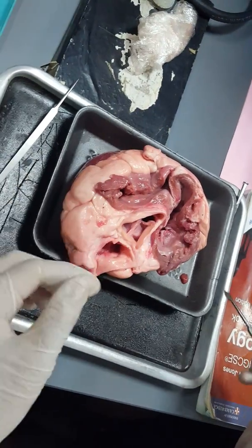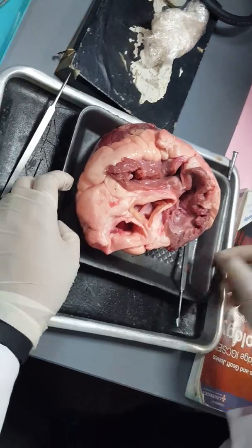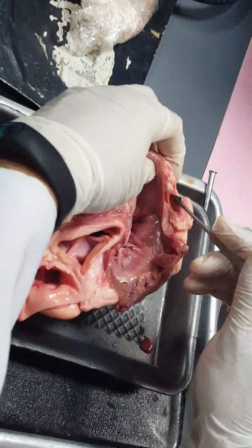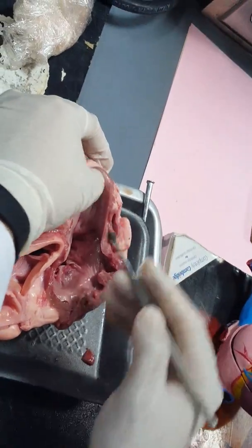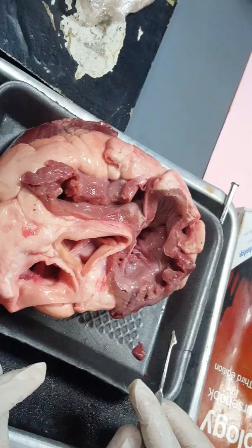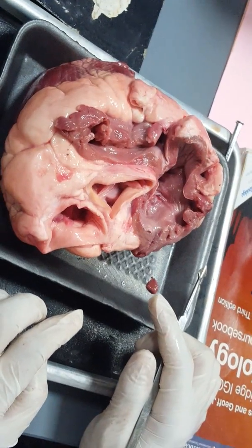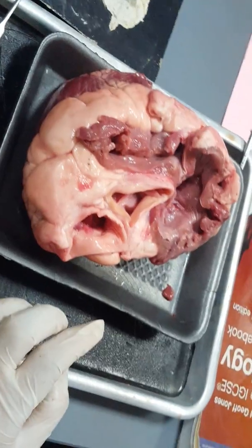Another very important notation: for example, we have one remaining vein. It was here. This is a vein. Why is the wall of the vein distinctly smaller and thinner than the wall of the artery? Very obvious. Why? Okay, Omar: because the blood lost its pressure after pumping, so veins need valves to control their blood flow.